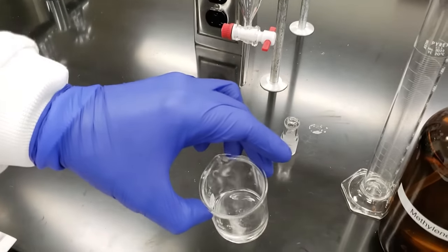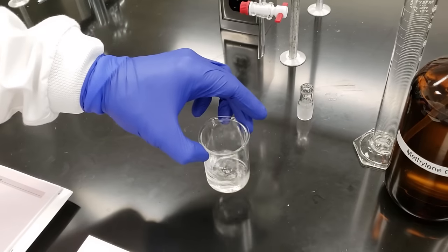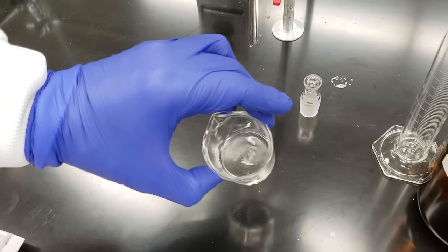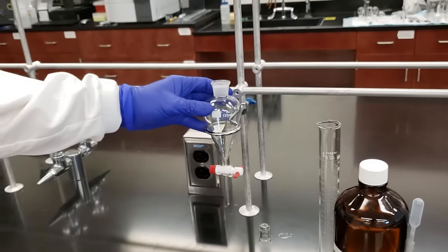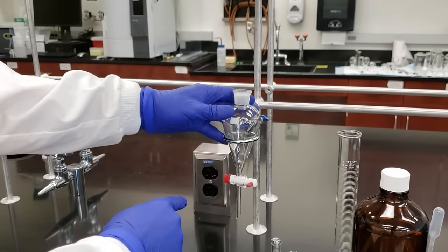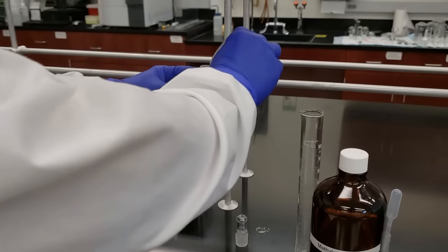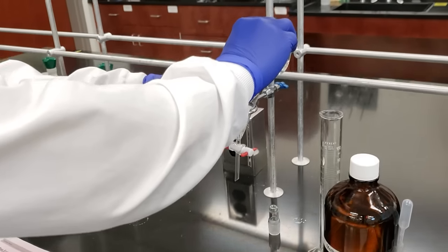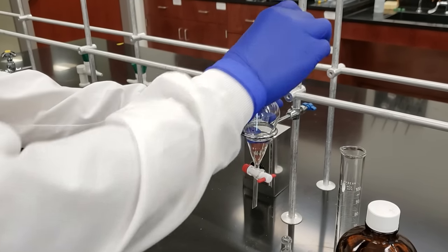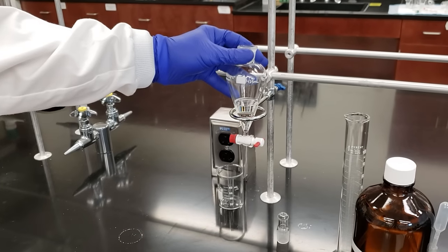I'm going to swirl this beaker to make sure all of our powder is dissolved. We've got a few crystals being stubborn, so we'll keep swirling. And there we go — everything is now dissolved into our methylene chloride. We're going to pour it into our separatory funnel. First things first, make sure our stopcock is in the closed position. The worst thing that can happen is we pour it in and it goes straight through onto the bench top — we want to avoid that at all costs. We've now got our methylene chloride layer placed in our separatory funnel.